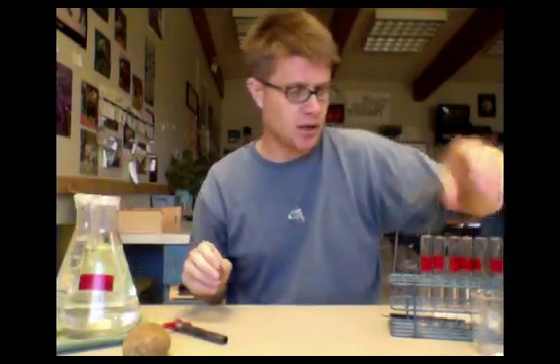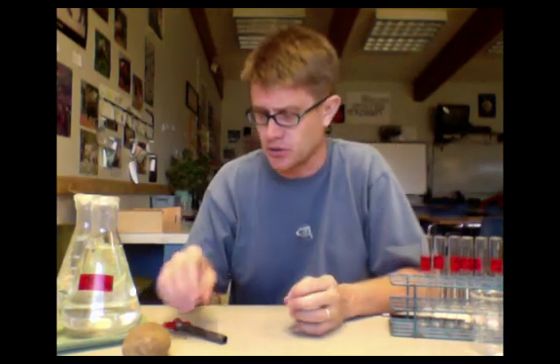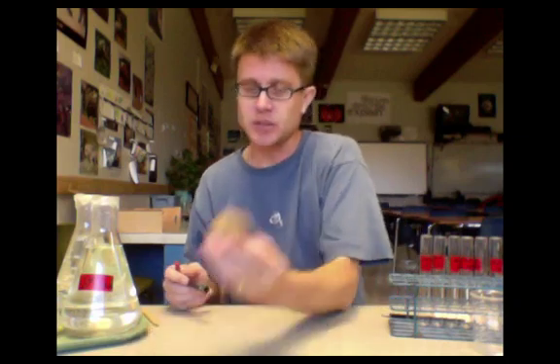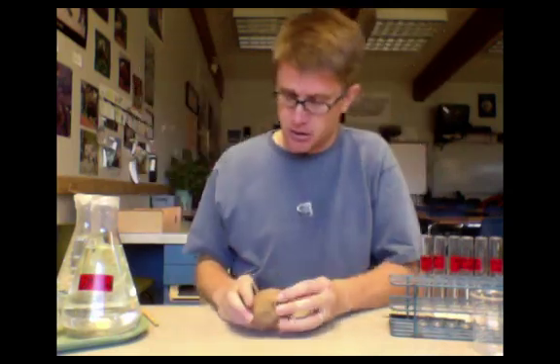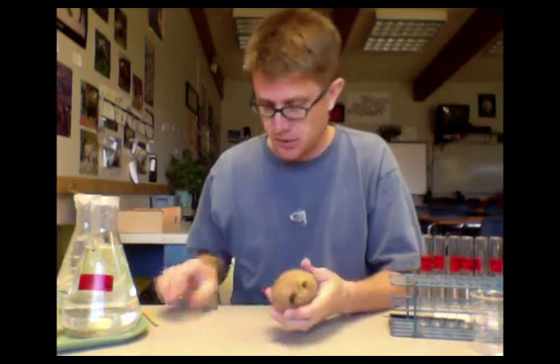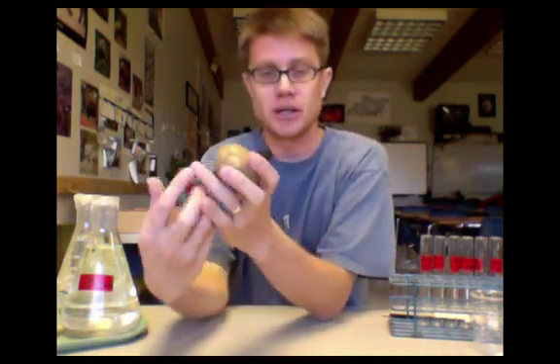Let me show you how to set up one test tube. What you're going to use is a potato and we'll use a potato core. You push like this through it and then you're going to go all the way up the other side. Don't ram it into your hand because you could cut your hand with it. Then essentially you push it like this and the potato core comes out.